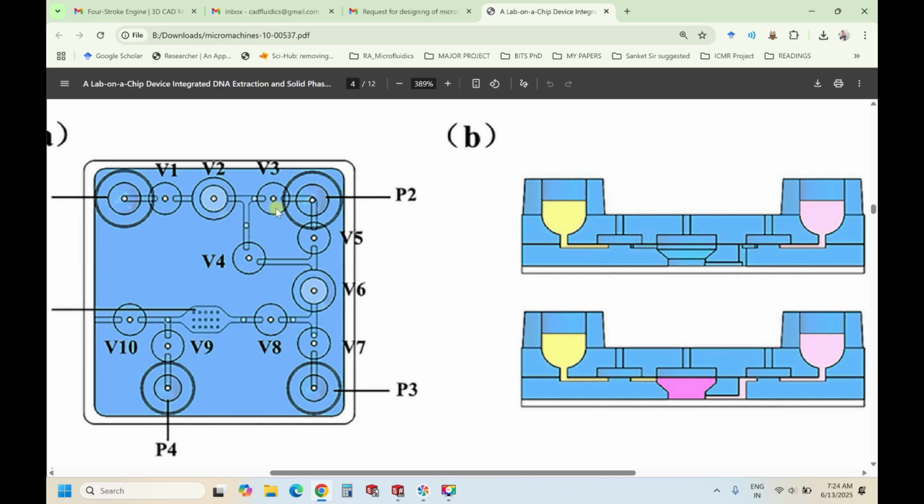So basically, there is a valve which has a third layer connection to the second layer connection, and then the top layer connection. Even this, I think the authors have missed V9, because they could have shaded it with this color. It was complex for me also to understand this, and later after reading everything, I understood that V9 is also at the third layer. So basically V2, V6 and V9, including this reaction chamber, are in the third layer, and V1, V3, V5, V4, V8, V7 and P3, P4 are all in the second layer, and the top layer is for the outlets.